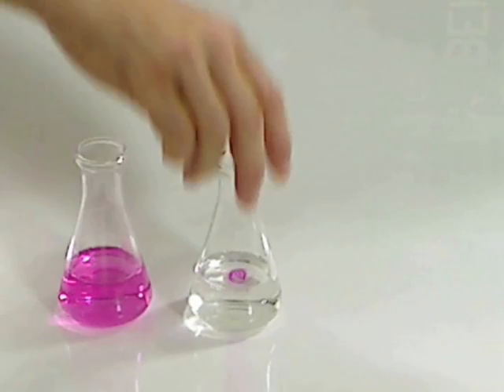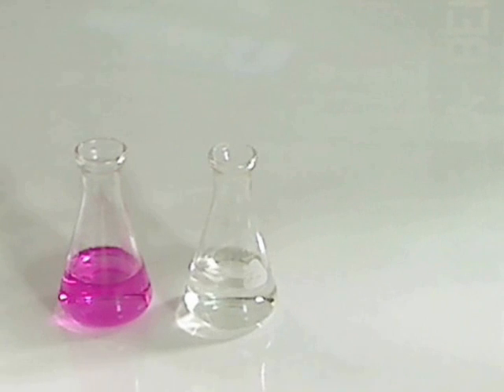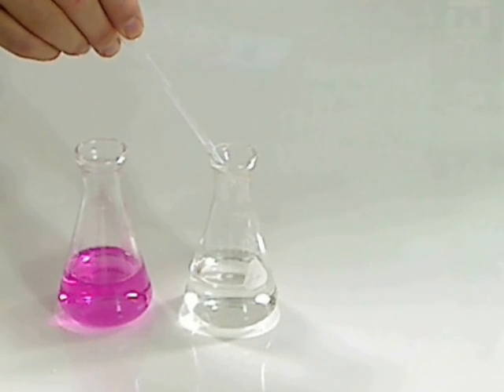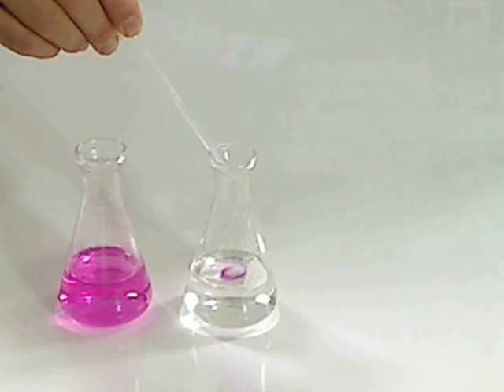As the pink starts to stay around for longer periods of time, we're getting closer and closer to the equivalence point for this pH indicator.